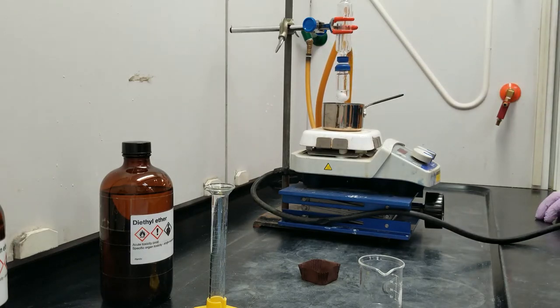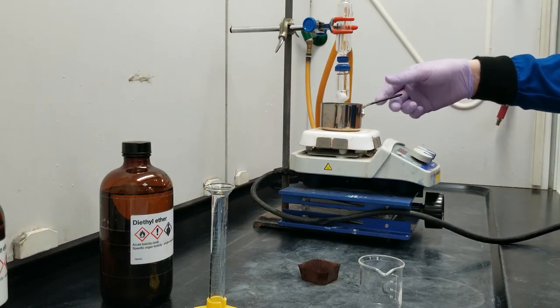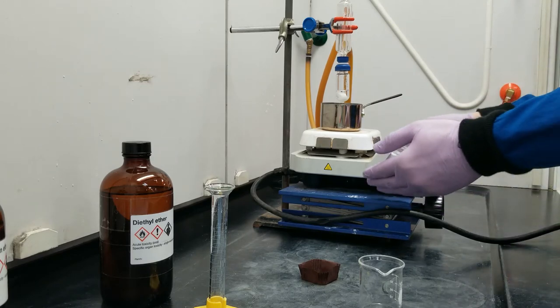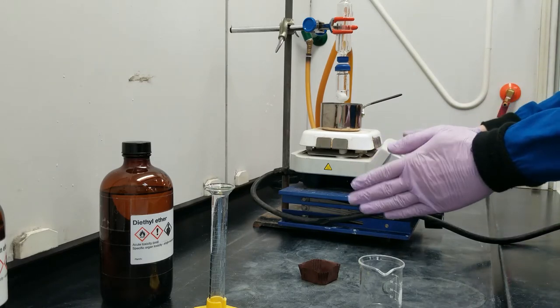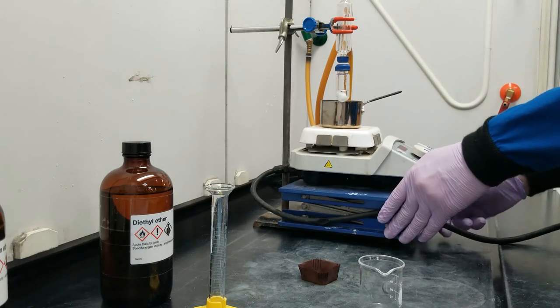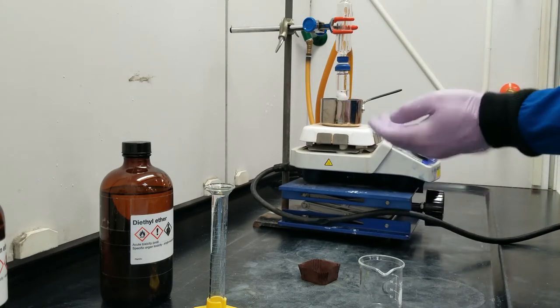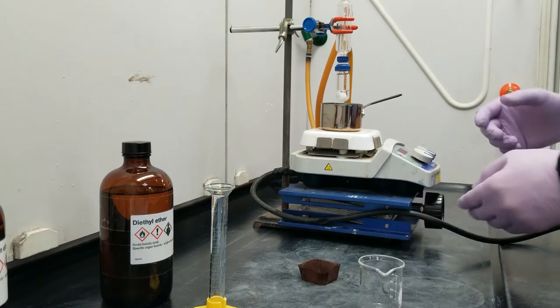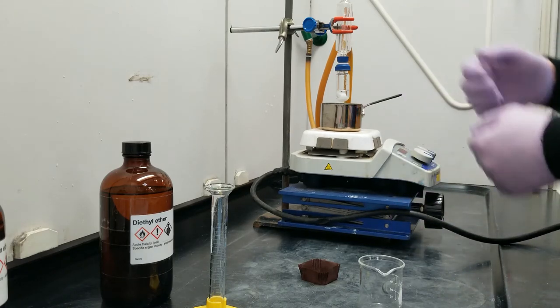I'm just going to screw it into place here, and it's always a good idea to set up your heat source on a lab jack and bring the heat up to your reaction. That way, you can just take the heat down later in order to remove the flask, or if you need to manipulate anything.